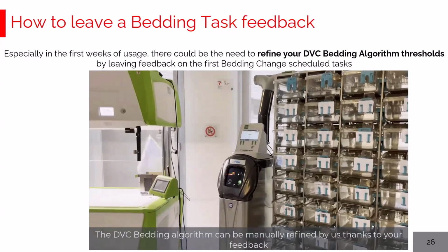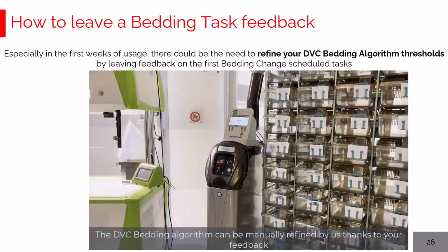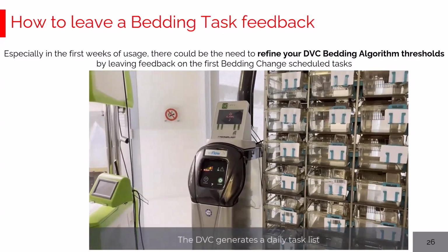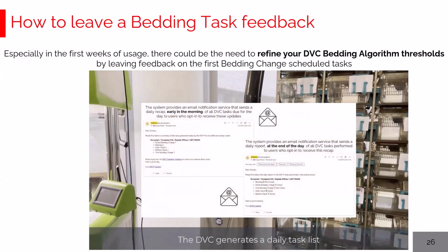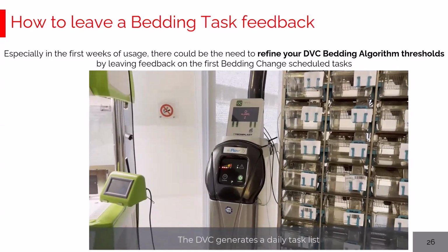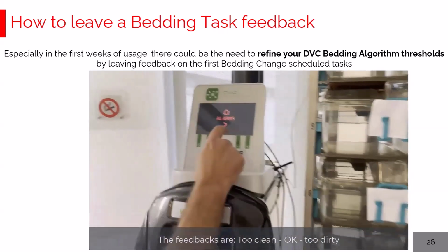Let's talk now briefly how to leave feedback to refine the DVC bedding algorithm outcomes. As said, the DVC early in the morning produces a list of dirty cages to be changed based on the threshold set on the DVC bedding algorithm. You can leave different feedbacks to refine these thresholds along the way. But let's start step by step.